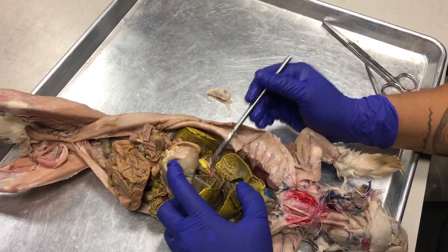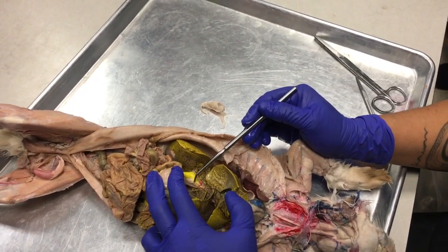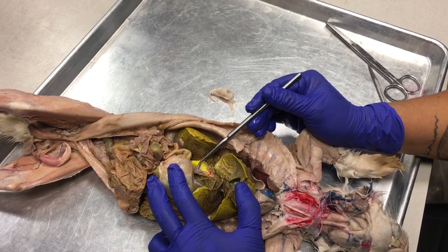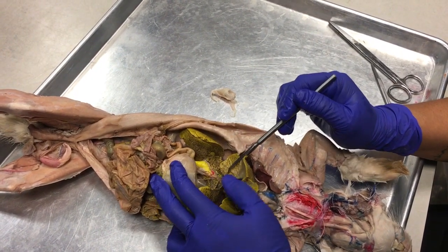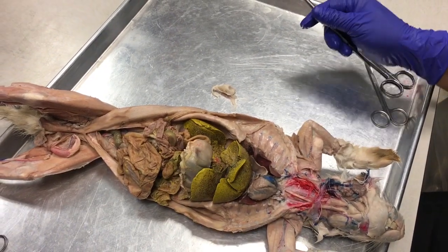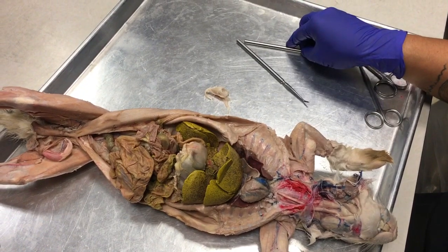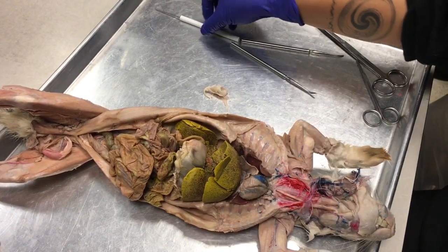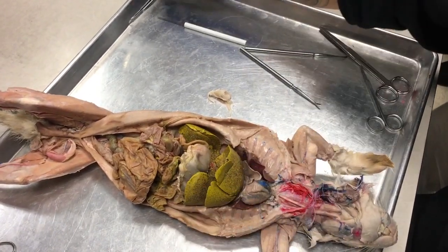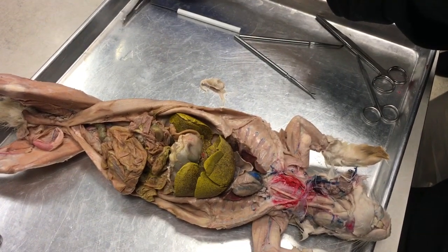Now, I ruined all of these lovely ducts here. So what you can do is, and maybe I'll try later, or maybe we'll just leave it off the exam, but if you find the duodenum and you follow the connection between the duodenum and the liver, you can find the bile ducts, okay? So there are two bile ducts. Well, there are three, and they're shaped like a Y, and they dump their contents into the duodenum, first part of the small intestine, okay?